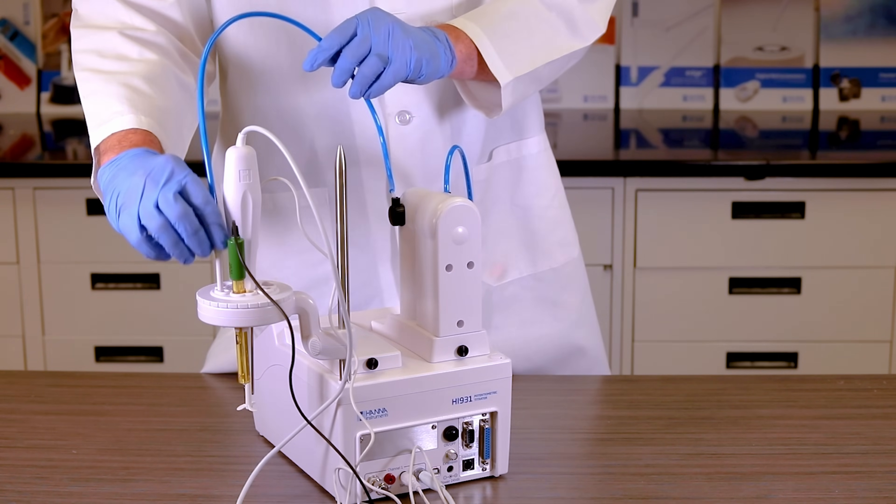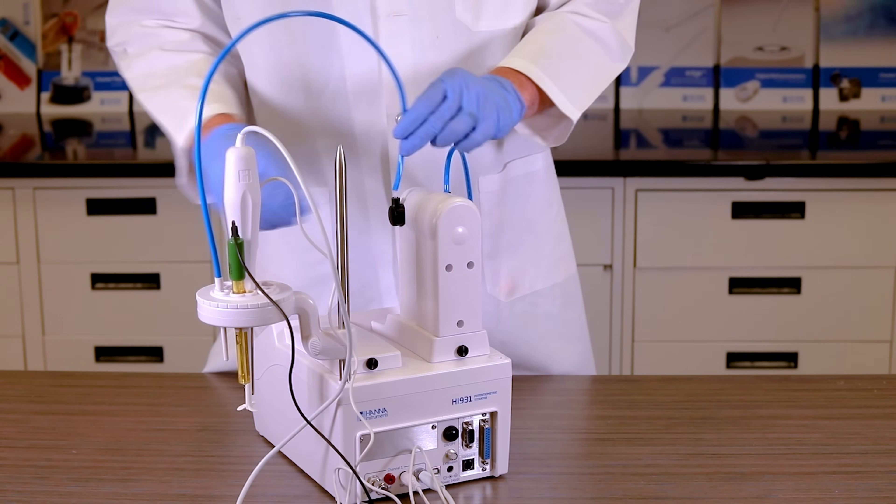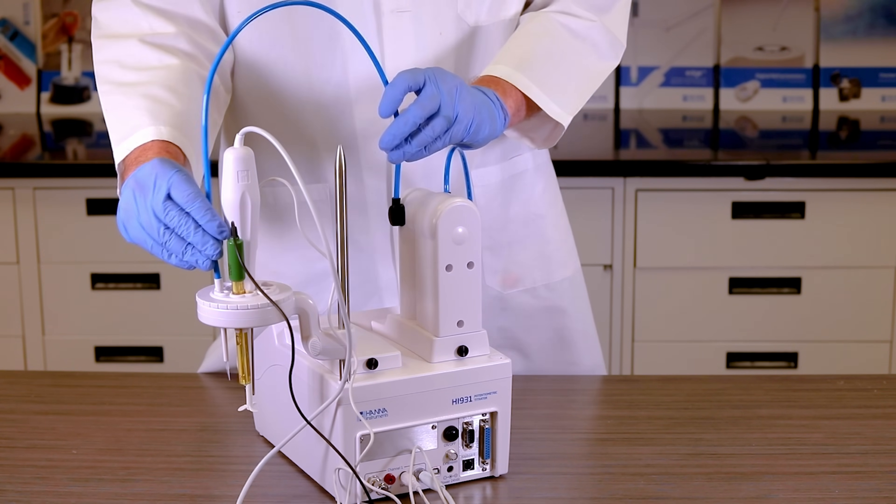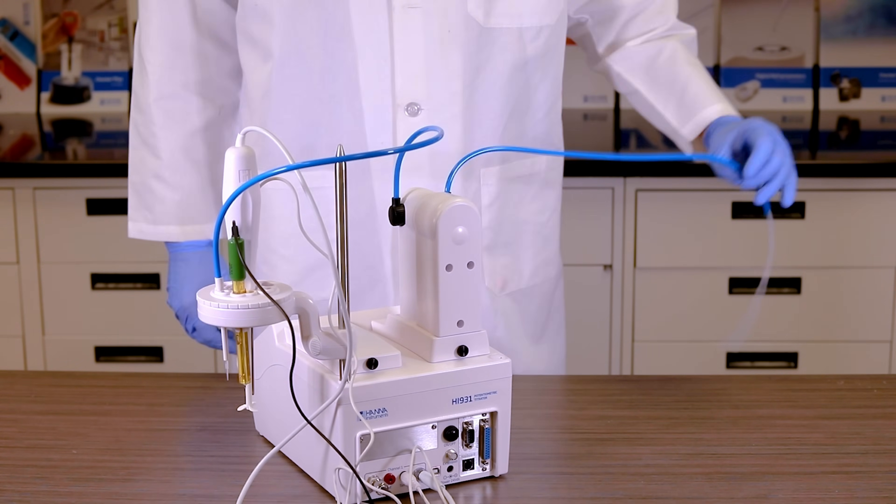Slide your burette onto the pump assembly. Ensure the burette plunger fits correctly into the pump key. The burette should be flush with your pump assembly.